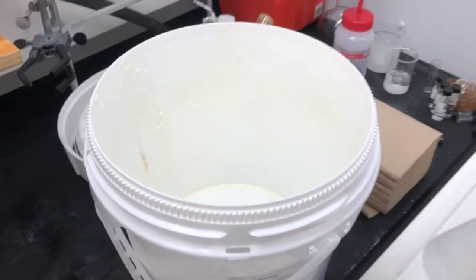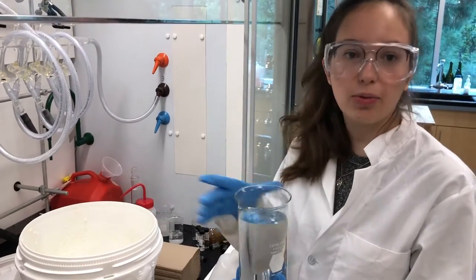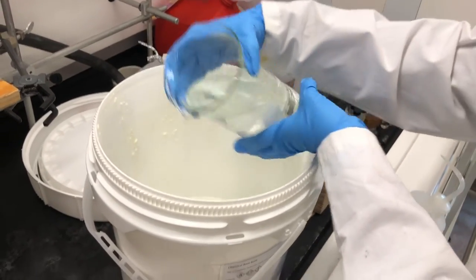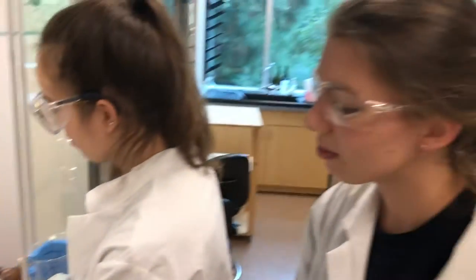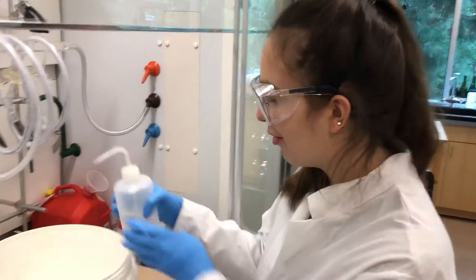So once we have emptied out all the contents of the old base bath, we're going to clean the container with some hot water first of all. You want to get all those potassium carbonate and crusty bits off of the sides of the container. For the sides, I also like to use a squirt bottle as well.